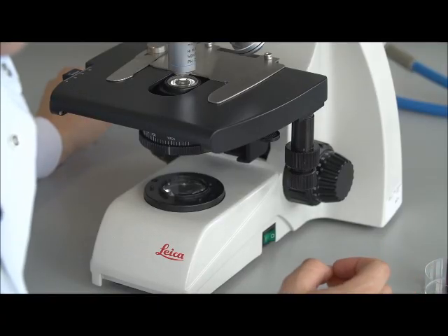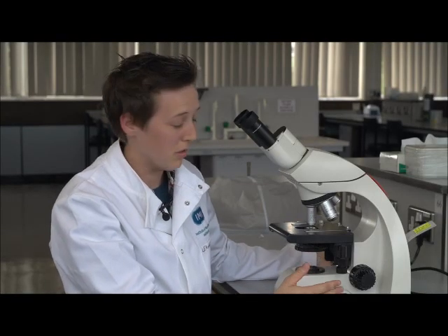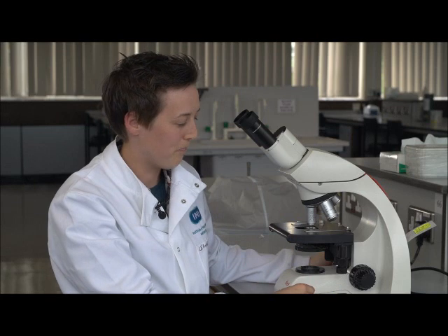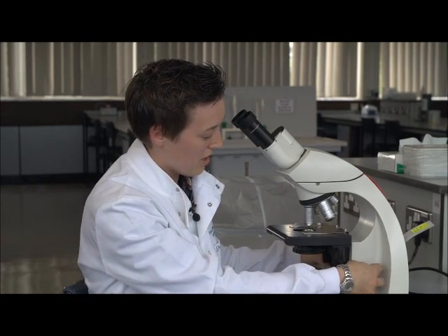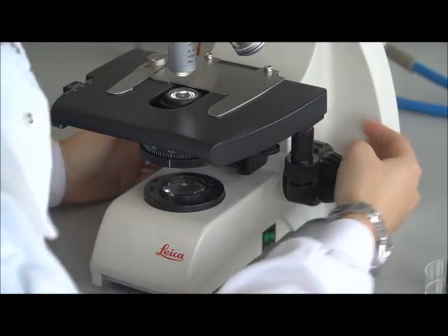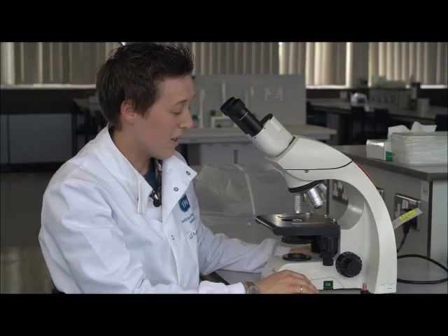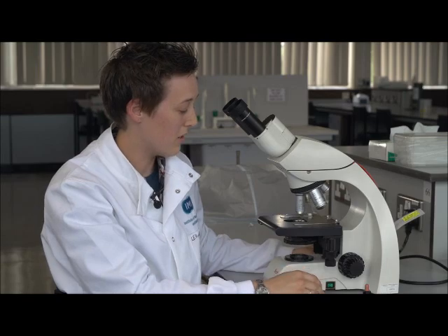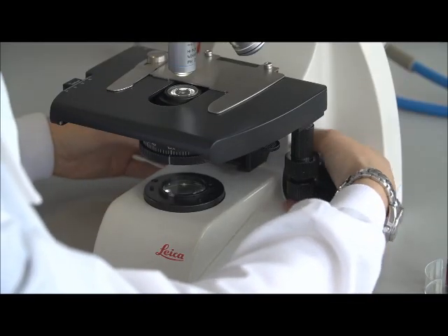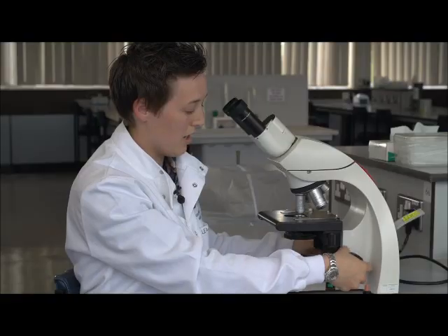So now, before we finish, we thought we'd go through some common mistakes for people who have troubles using the microscopes or can't find their specimen. A typical issue is that the stage is very low. Now, if we go by and see students where the stage is very low and they're struggling to find their specimen, it's probably just because the stage is too low. So you need to raise the stage up, start from a very high position. The focal plane should be only 1.5 turns from the top position of the stage.